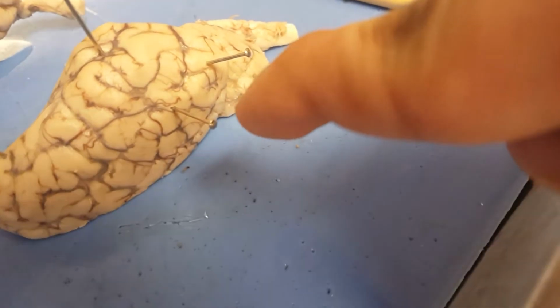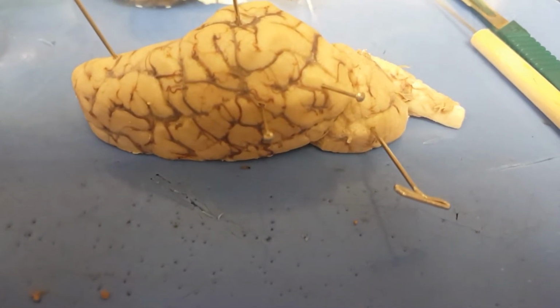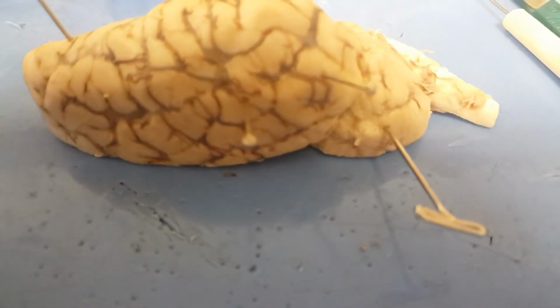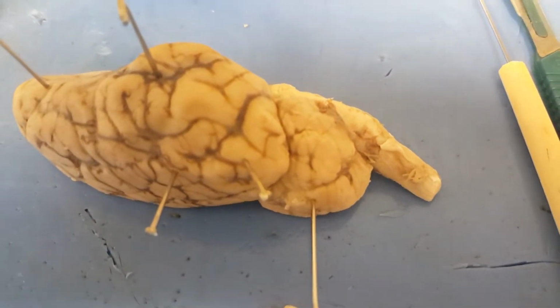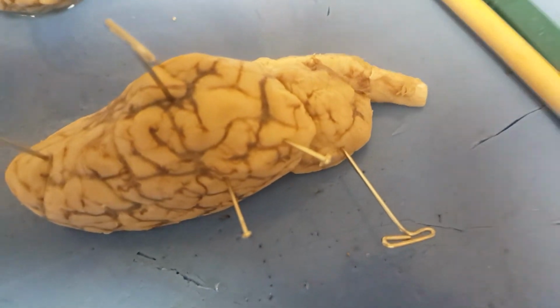This is the parietal lobe. Either of the paired lobes of the brain at the top of the head, including areas concerned with the reception and correlation of sensory information. Right here is the temporal lobe. Each of the paired lobes of the brain lying beneath the temples, including areas concerned with the understanding of speech.